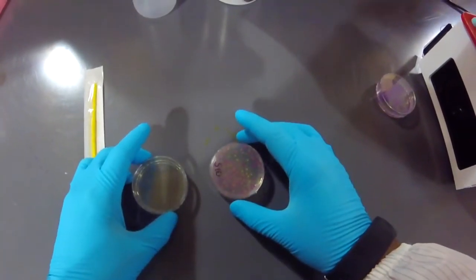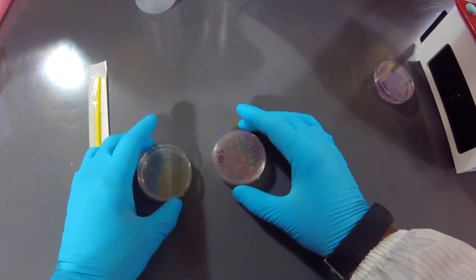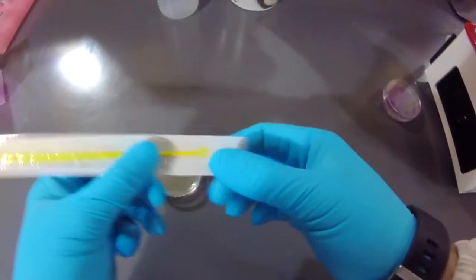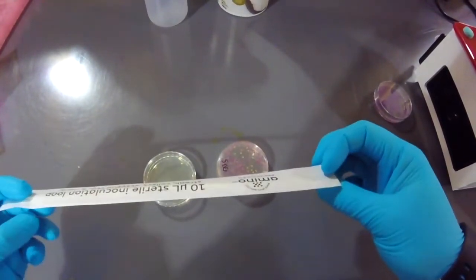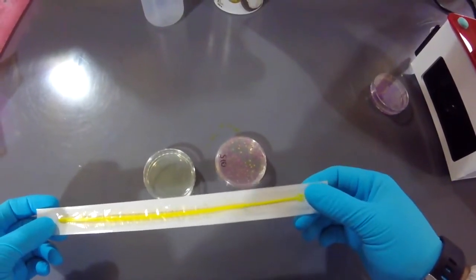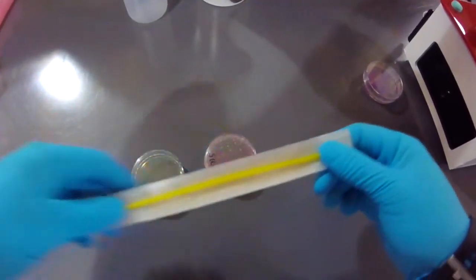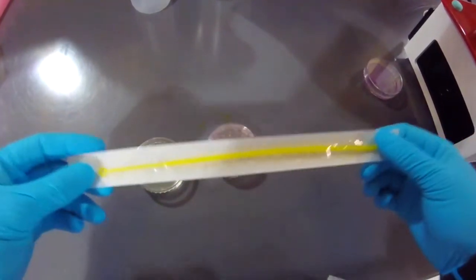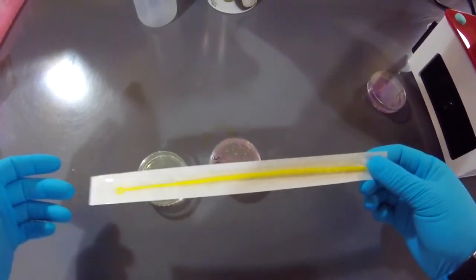Hello, this is a really short video about what we call super streaking, where if you're very low on yellow loops, for example for streaking, this is an emergency procedure so that you can try and do a proper streak with a single loop.